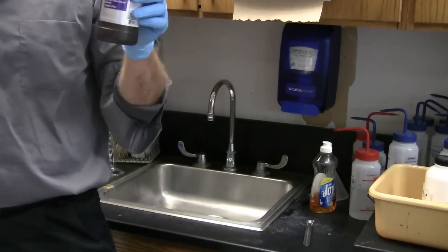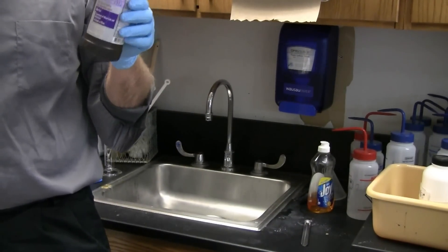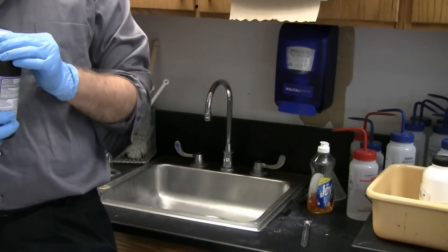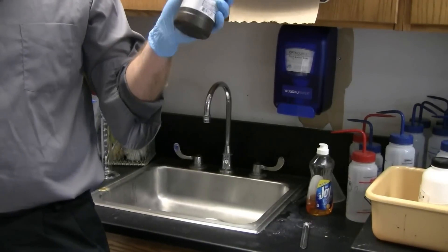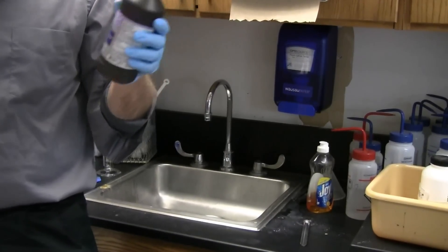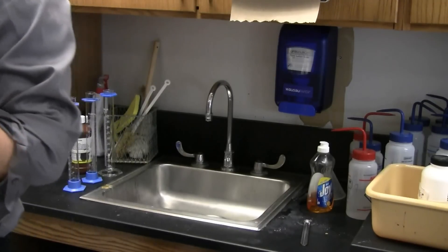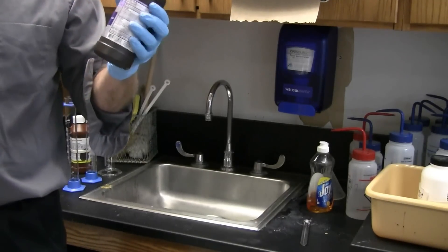Some of you guys might have this in your medicine cabinet back home, put it under cuts. It's a pink stuff. It's not pink, no. It's used as a common disinfectant. If you get a cut, you can put it on it, it cleans it out. It does burn a little bit, yeah.